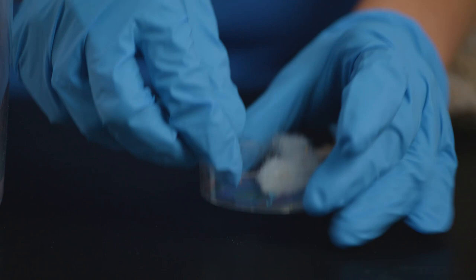Now that everything is prepared for the nymphs to hatch, place the egg in its cotton ball in the culture container on top of the netting or climbing cloth.